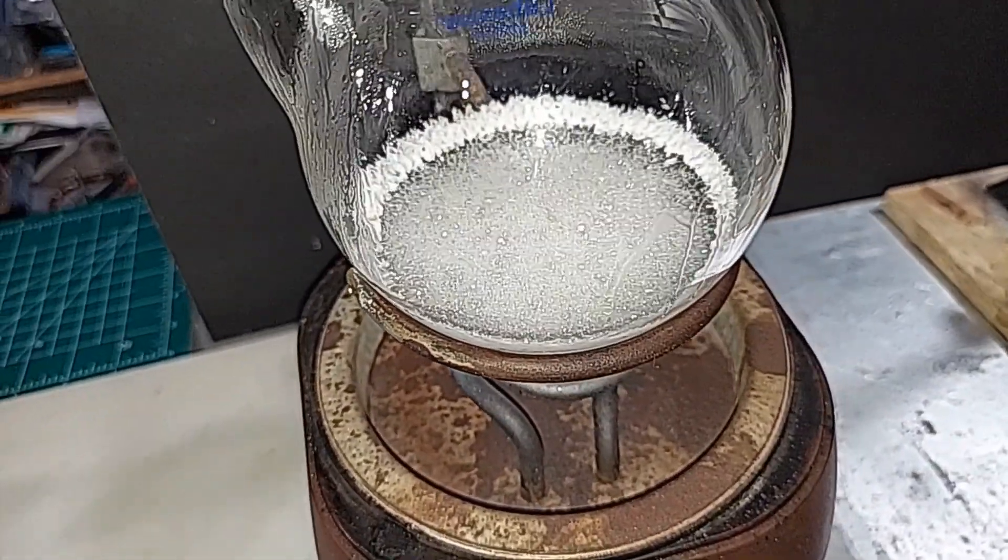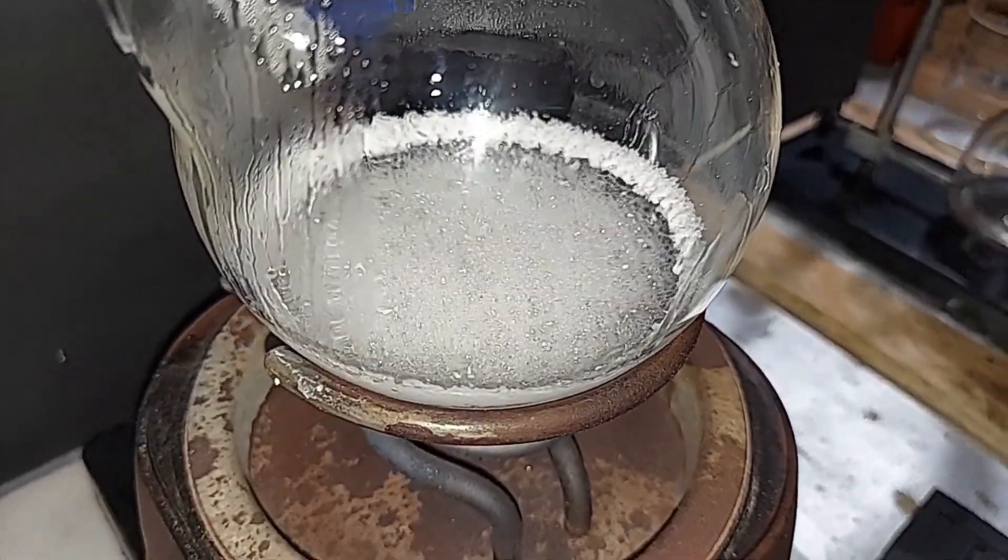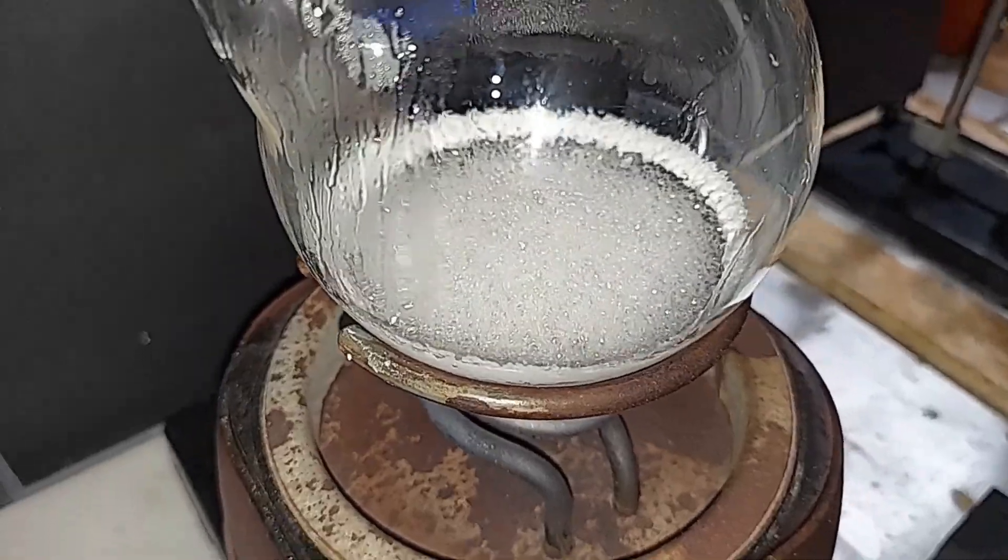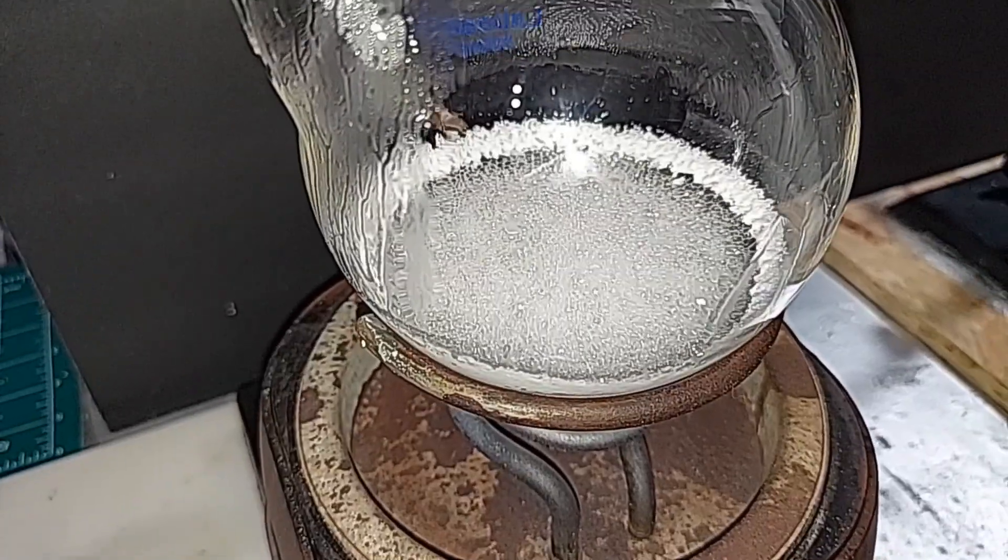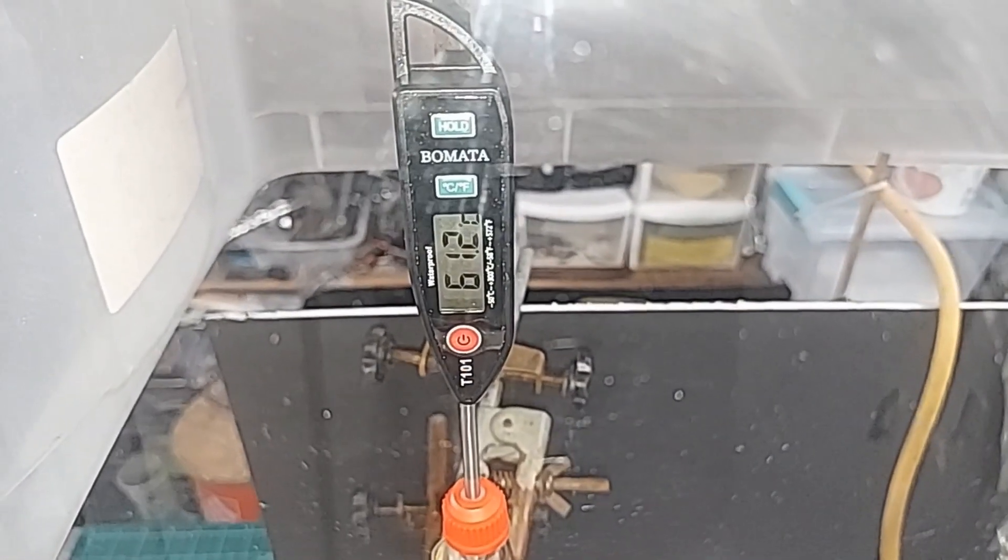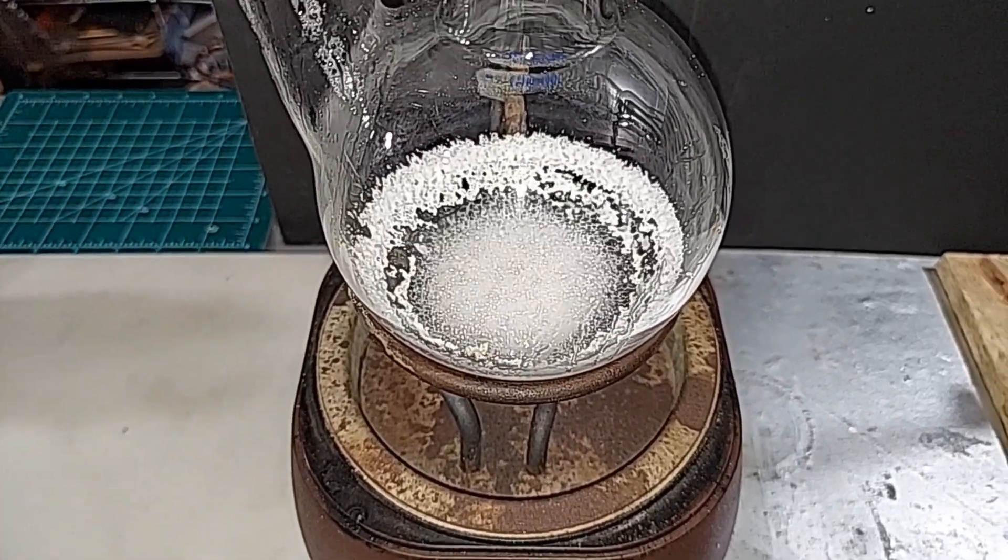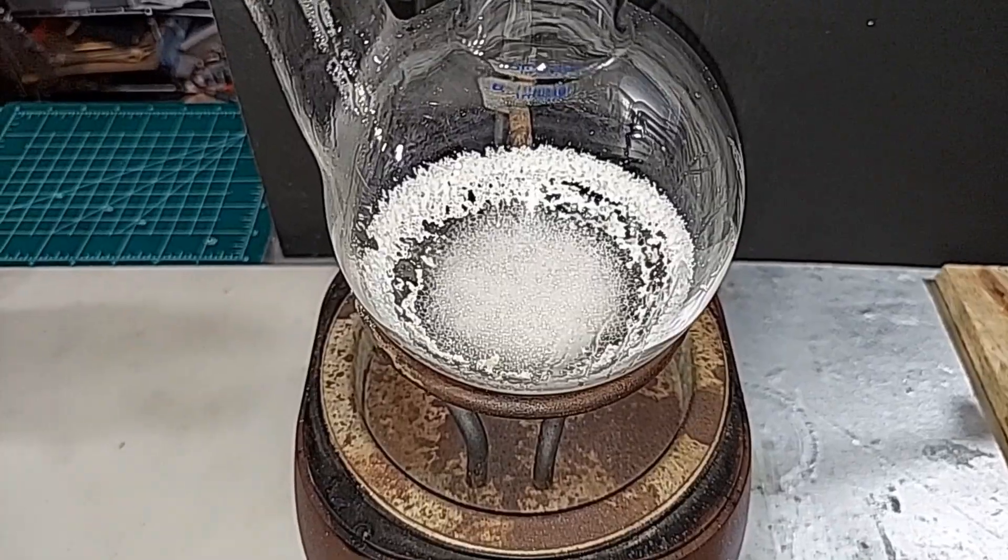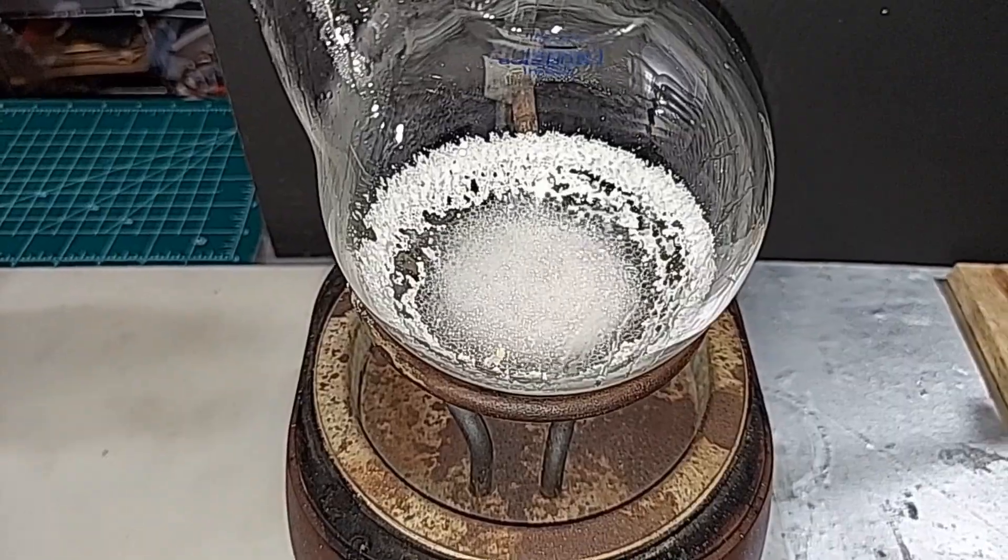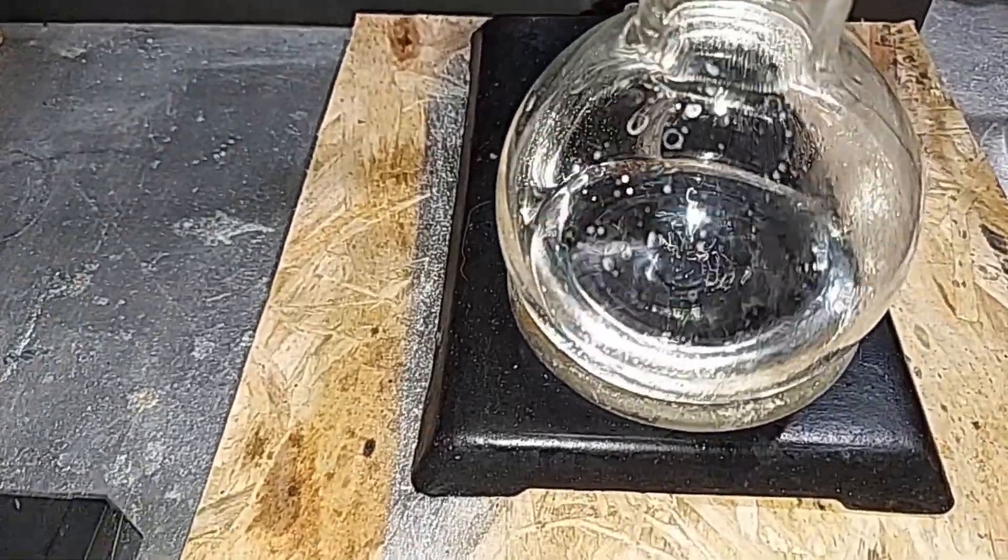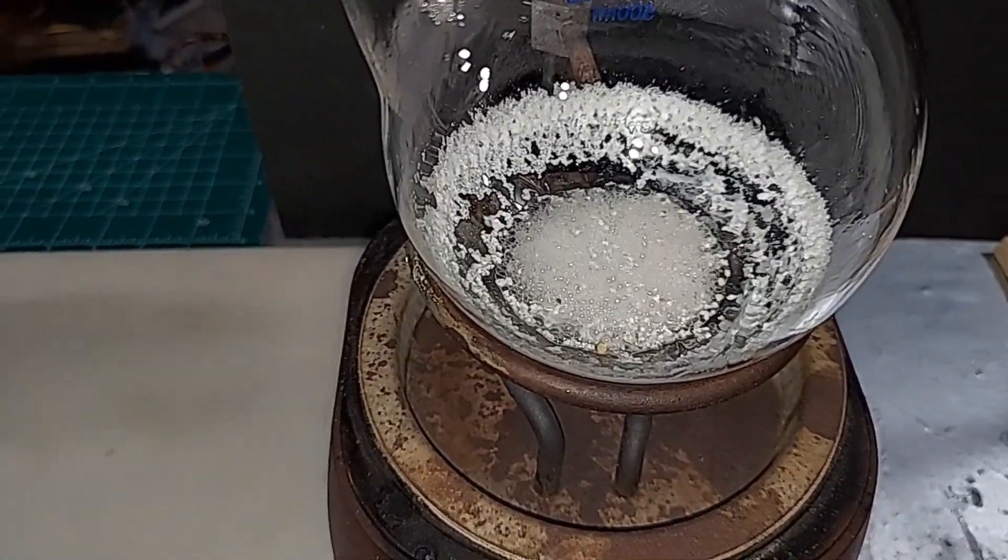Unlike other solids that get left behind, I'm not really worried about the calcium chloride. Its melting temperature is around 770 degrees Celsius or around 1420 degrees Fahrenheit, and it's also very water-soluble, so I should be able to rinse it out pretty easy. The temperature is staying right in the right range, even though there's almost nothing left down here, which means most of the water has already been taken out. There might be a little bit left in the calcium chloride at the bottom here, so I'm going to leave a little smidge of liquid down here just to make sure that water stays in there and doesn't come over here and keeps this pure. Okay, I'm going to turn this off. That's what we're going to leave behind right there.